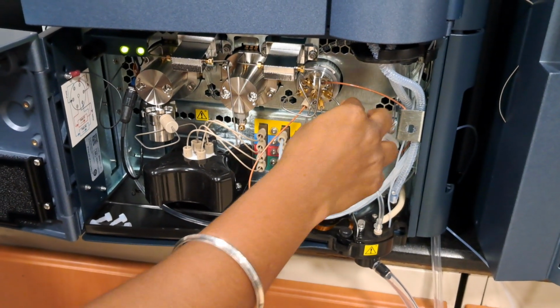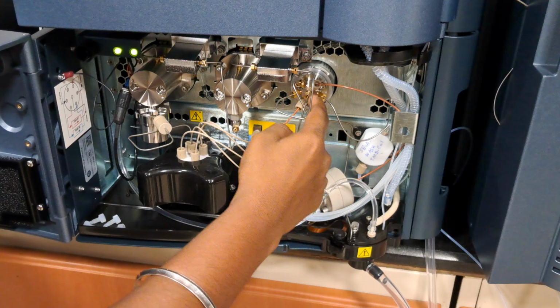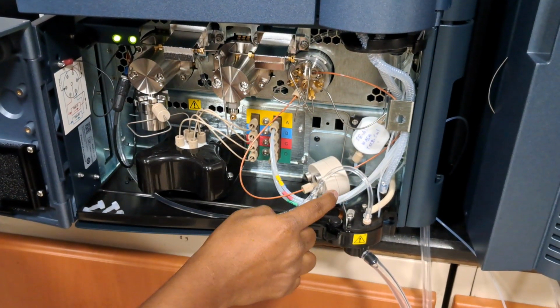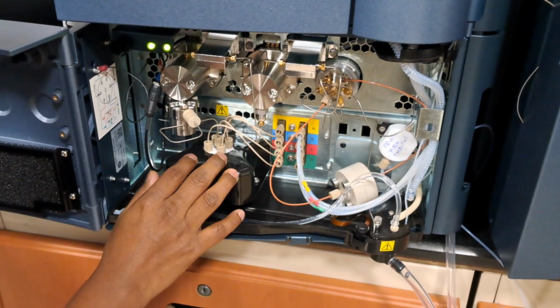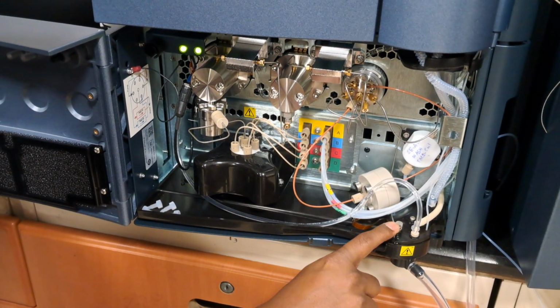Again, the outlet will be coming from this one. This will be connected to the main outlet valve. So it lies on the pump side only. Whatever flow comes from the top side goes to the pump. It gets degassed, gets mixed to whatever composition you are setting, pumping is done here, and it comes out from the outlet line.